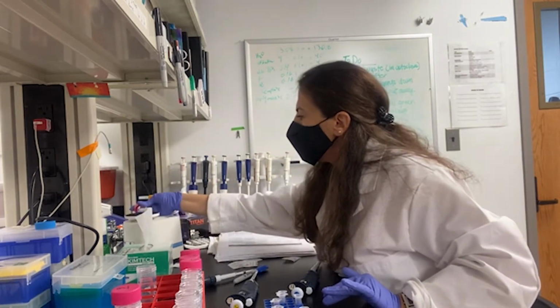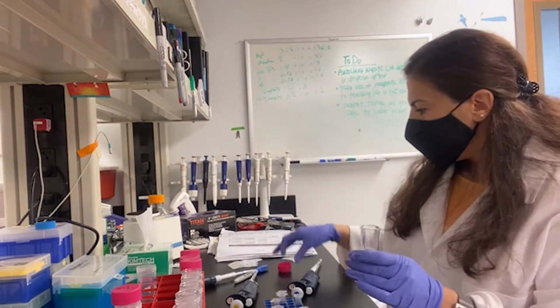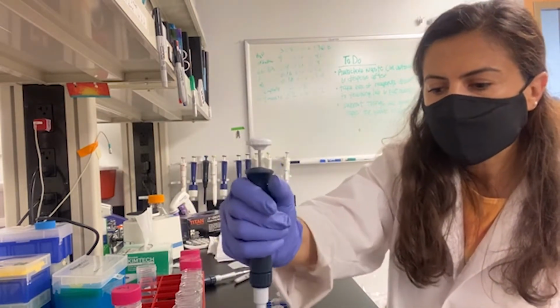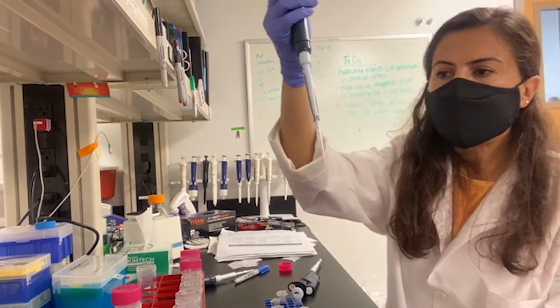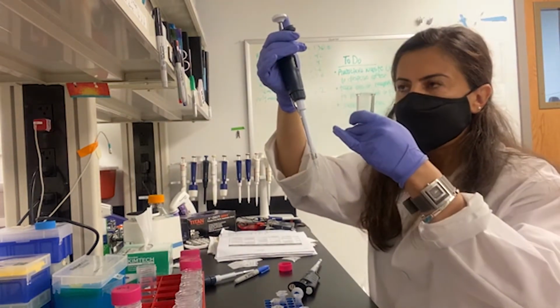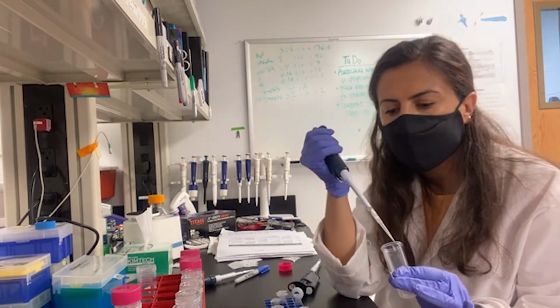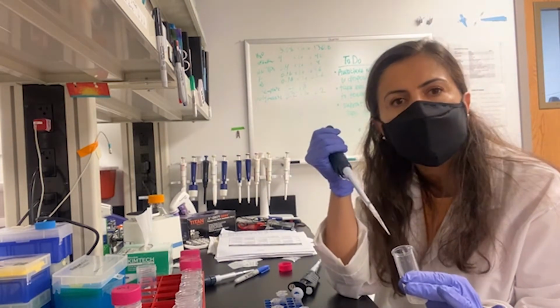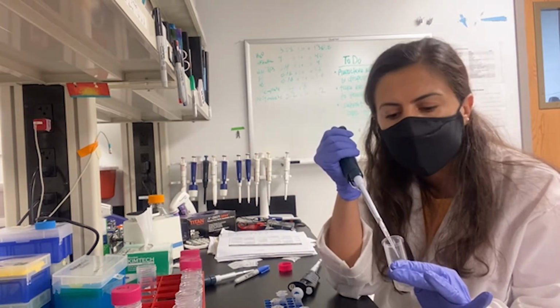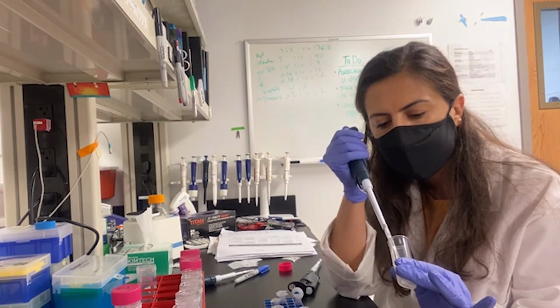Side to side. So it should be enough. Now I'm going to use 200 microliter pipette tips with the aerosol barrier because I don't want to contaminate my pipettes. And I'm gently going to slide my pipette tips over the membrane filter, so I want to get all the genetic material into the liquid part, and I don't want to lose anything.